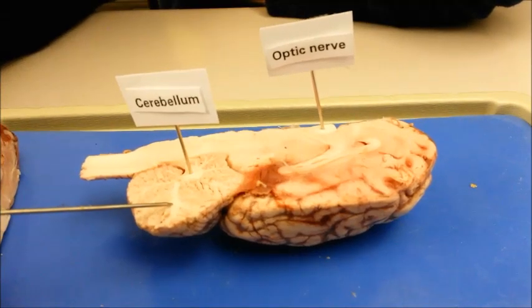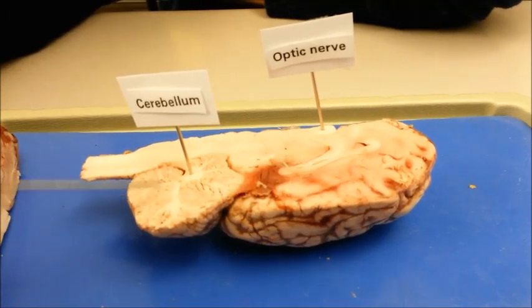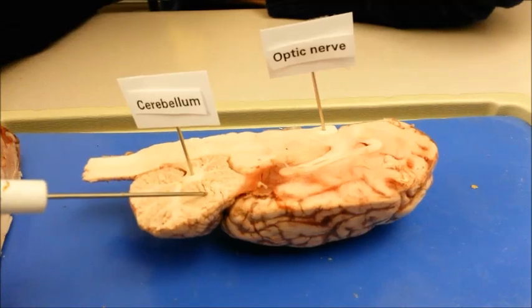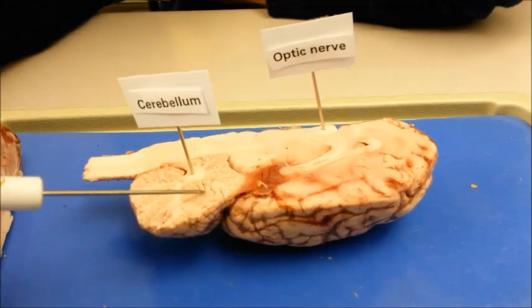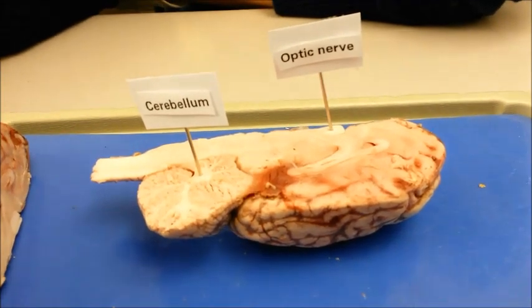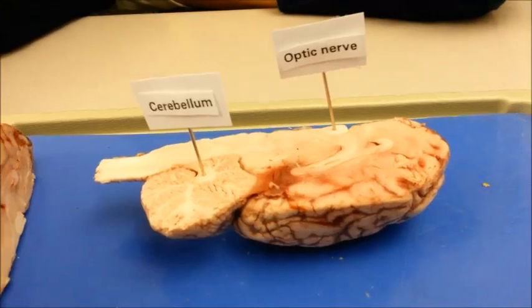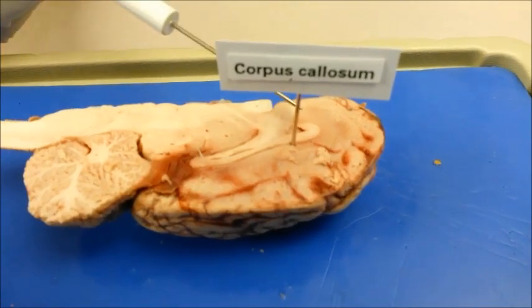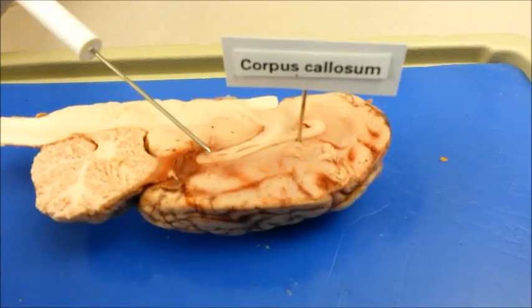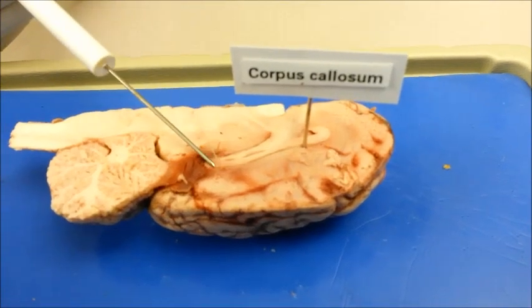White matter is a bundle of myelinated axons within the brain and spinal cord. It acts as a signal transmitter. Without it, communication within the brain may be damaged. The corpus callosum is the bridge between the two hemispheres, allowing them to send information from one to another.